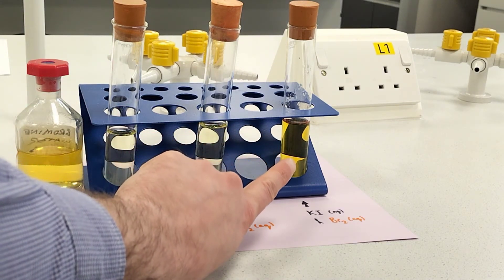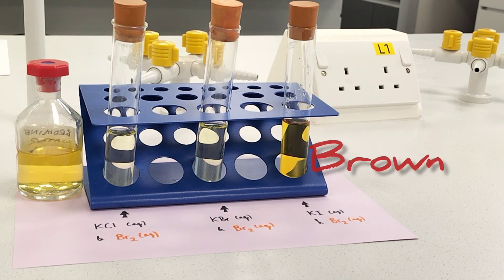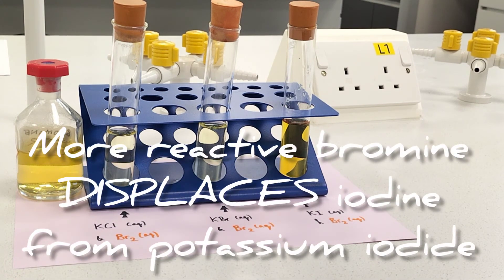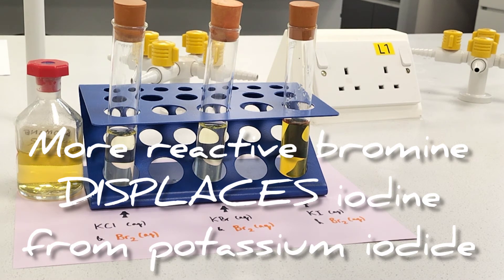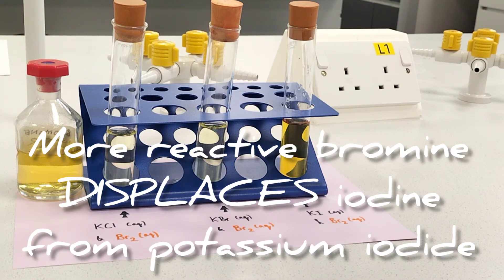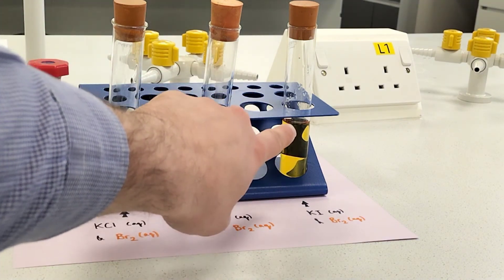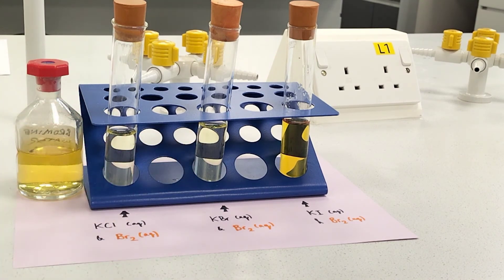But upon addition of bromine water to potassium iodide, it has gone a much darker orange approaching brown. That is indicative of a displacement reaction — bromine is more reactive than iodine and is displacing iodine from the potassium iodide. I2 molecules are building up in solution, and their colour is towards the brown end of the spectrum, hence the boiling tube darkening and moving away from the light yellow of the other two tubes.